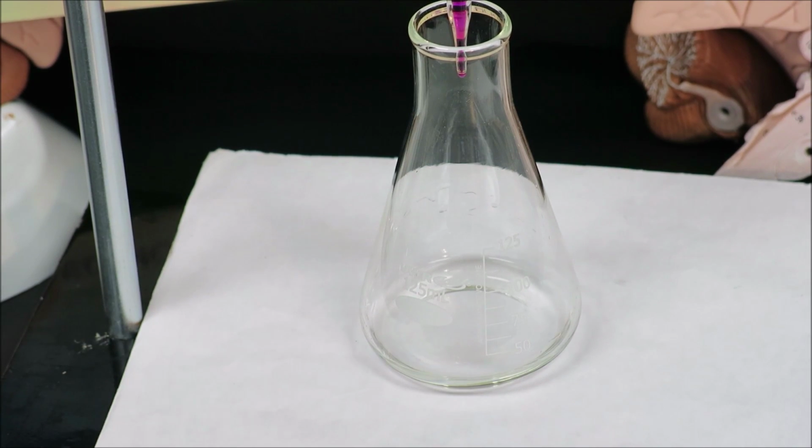We're going to go ahead and move that sample, bring in our second sample, and what we know now is the initial volume for this titration will be the final volume from the last titration. So the initial volume is going to be 20.0 milliliters, and I'm also fairly sure that it takes about 14 milliliters to react to the endpoint, to the equivalence point.